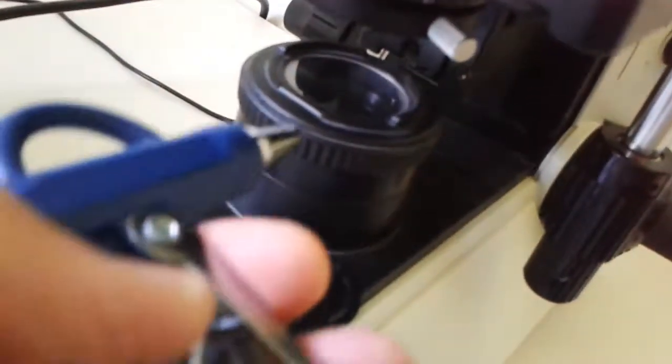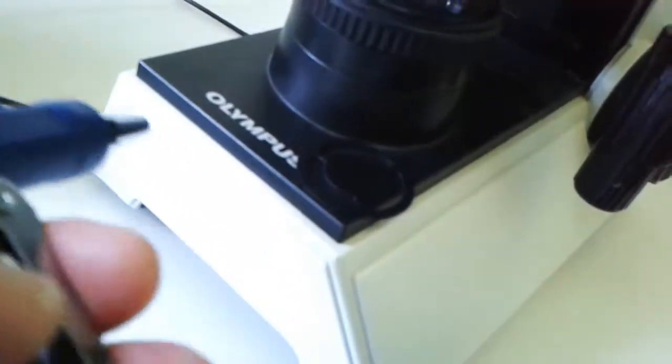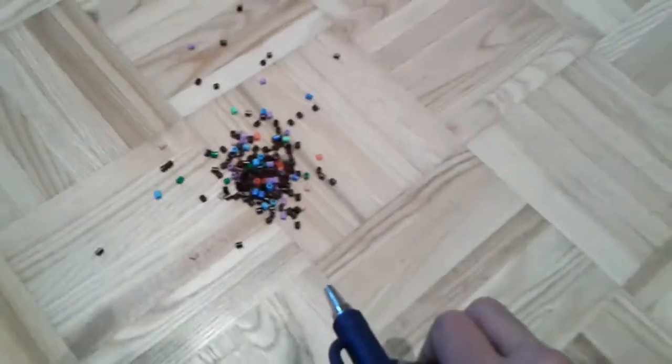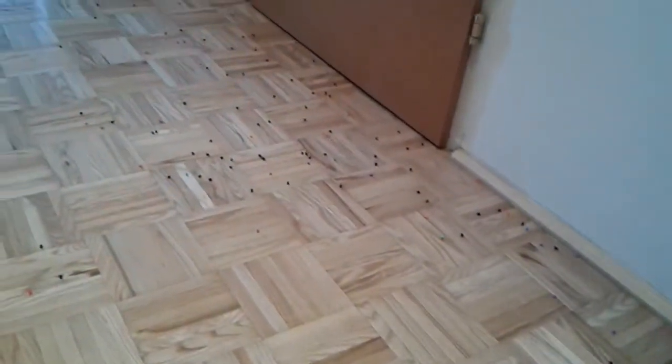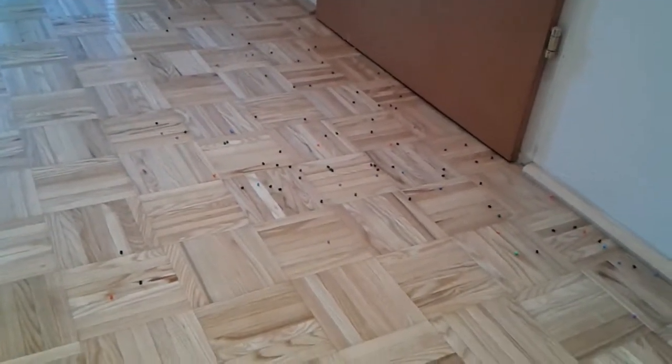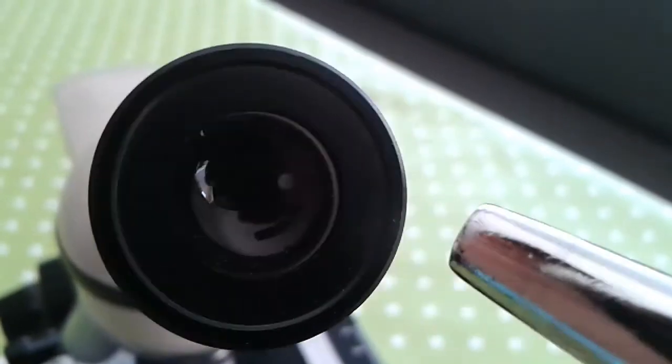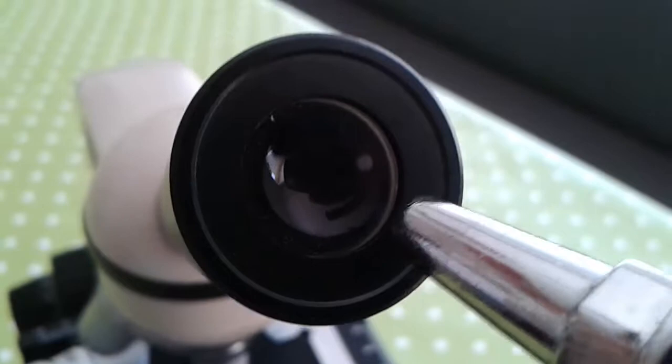And now the test. Seems to work. So this is now the test. Let's see how strong it is. Whee! Strong enough. Now we have to clean it up again. Does work quite well.